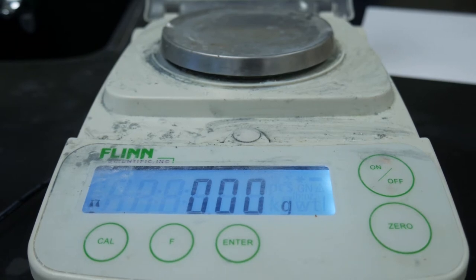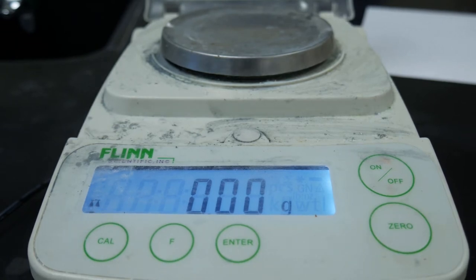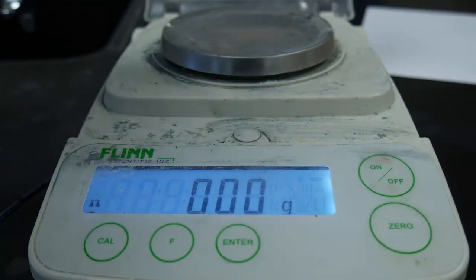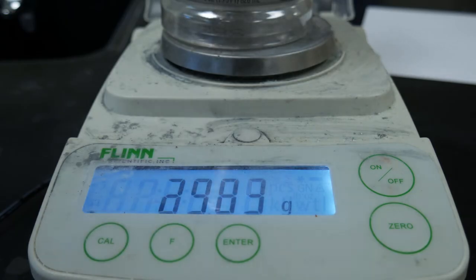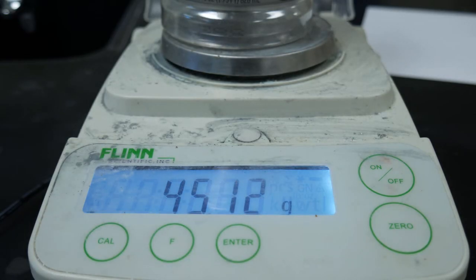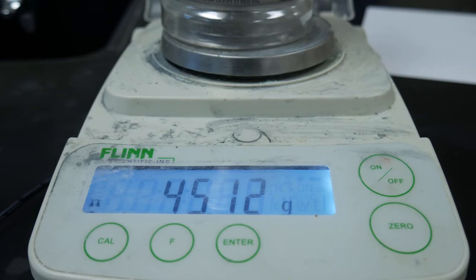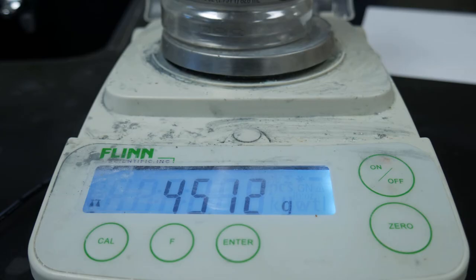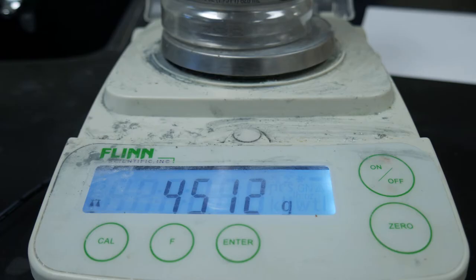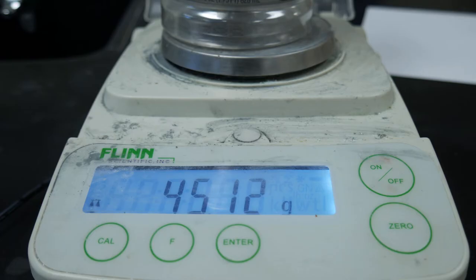This is now trial two of our lab. We're going to take an empty bottle — I just have a Gatorade bottle here — put it on the scale, and record the mass of the bottle empty. It looks like we have about 45.12 grams. Please record that on your data table as the mass of the empty bottle.